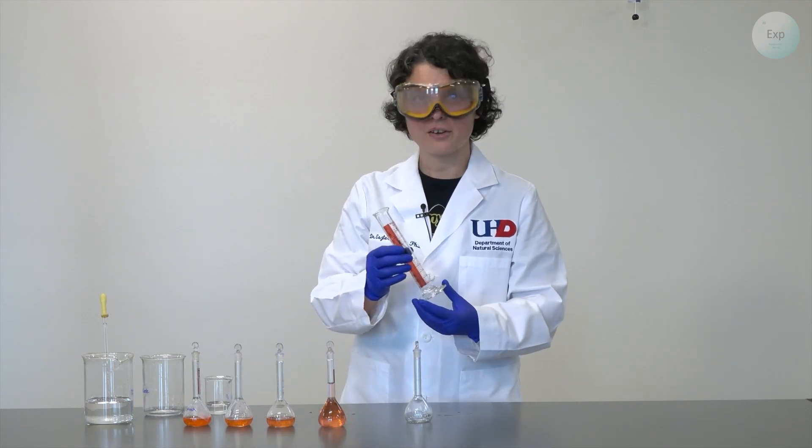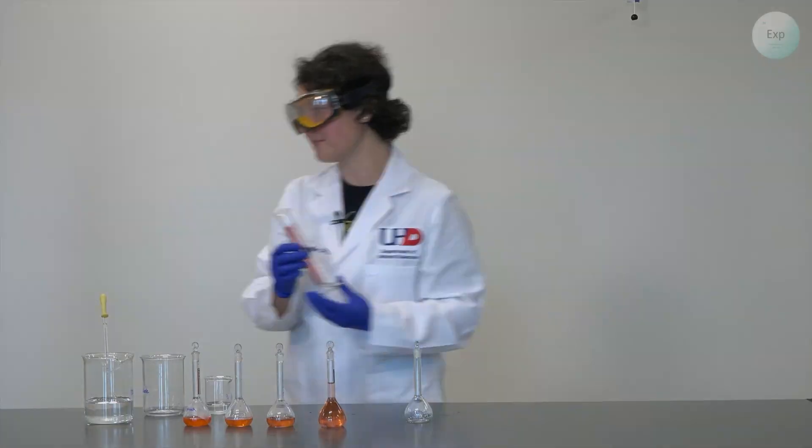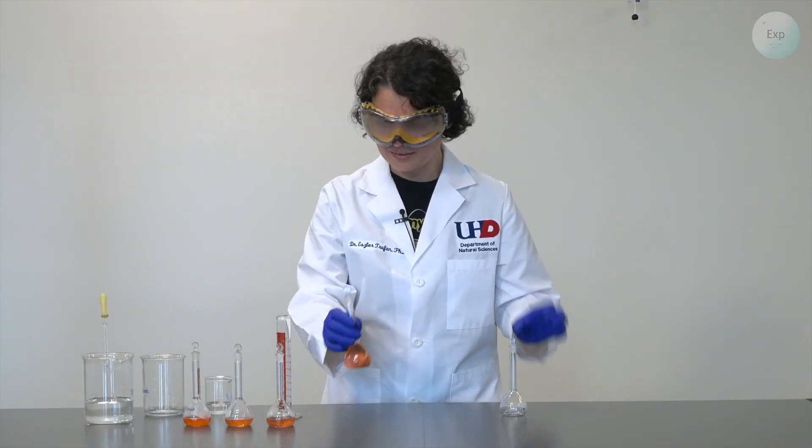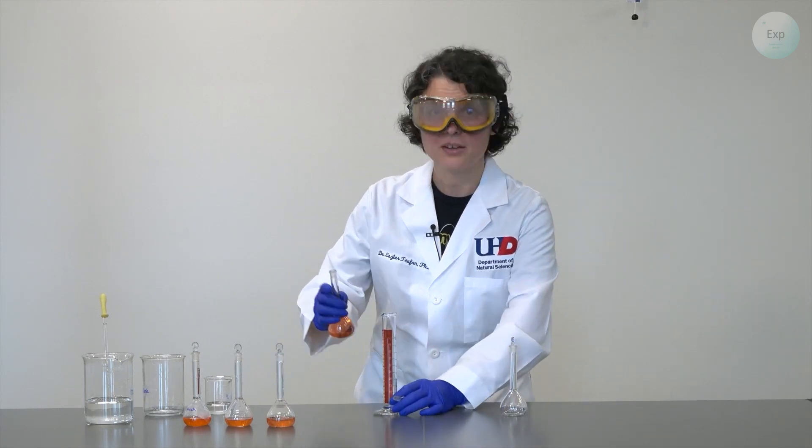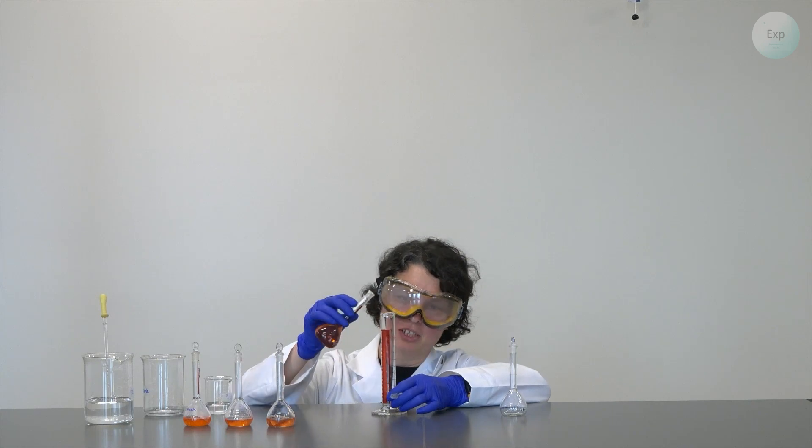And now we dry our graduated cylinder for our final measurement. Next, we take our final diluted solution and we measure out 35 milliliters.